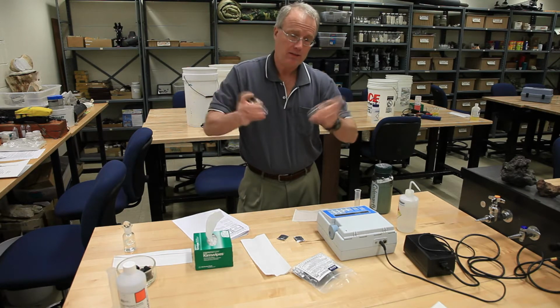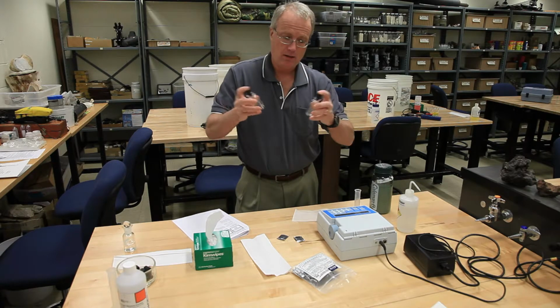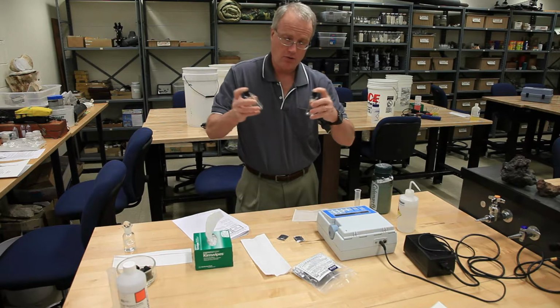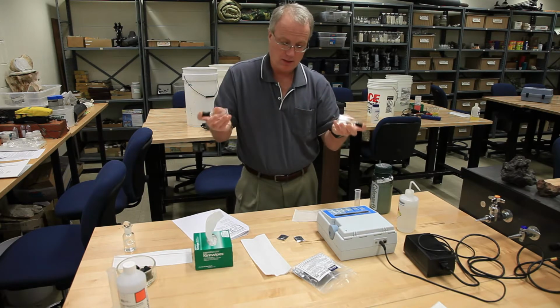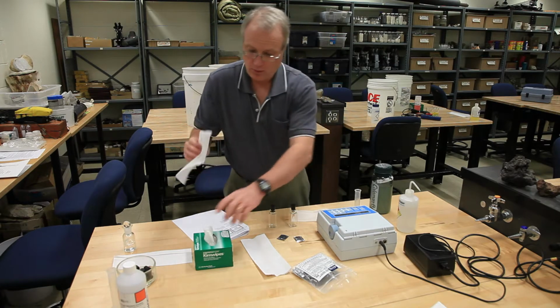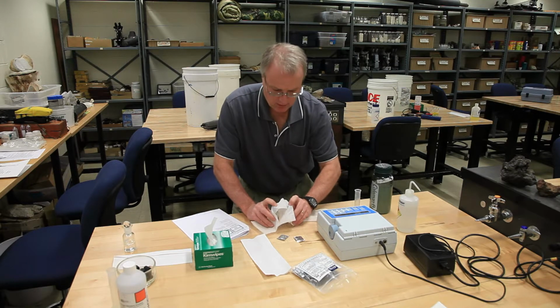You don't want to agitate them fast. You don't want to let them sit. You just want to basically turn them back and forth like this. Now, all of you should realize I'm making a grave mistake here. I am touching these with my bare hands. So, in point of fact, the way this process would look would be like this.